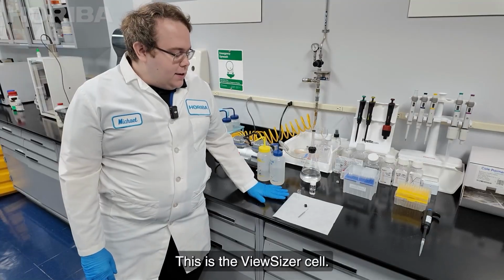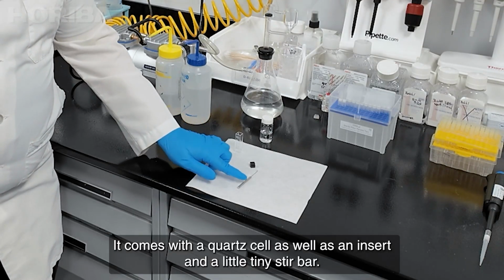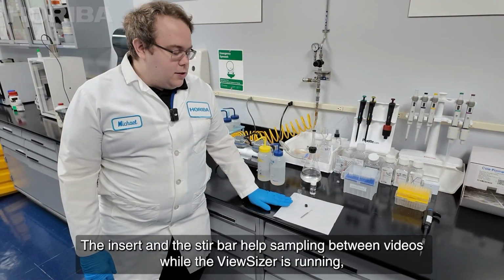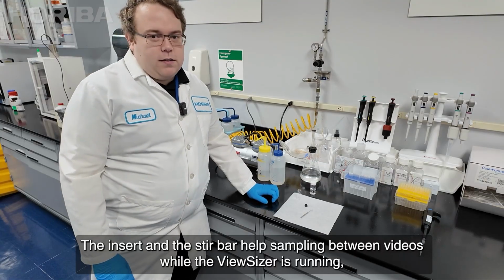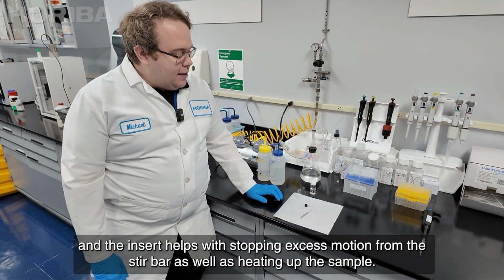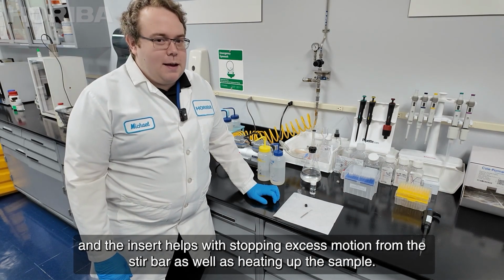This is the ViewSizer cell. It comes with a quartz cell as well as an insert and a little tiny stir bar. The insert and the stir bar help sampling between videos while the ViewSizer is running, and the insert helps with stopping excess motion from the stir bar as well as heating up the sample.